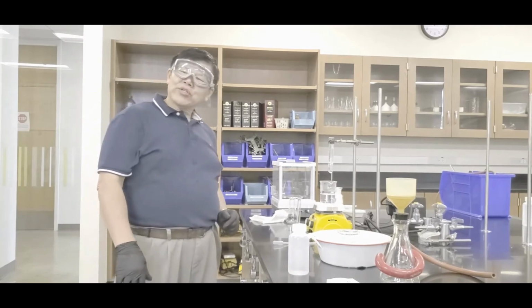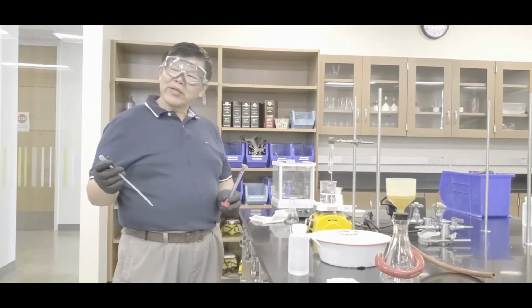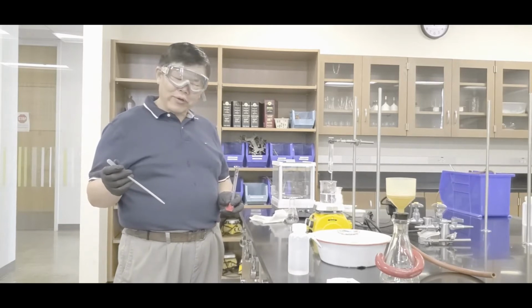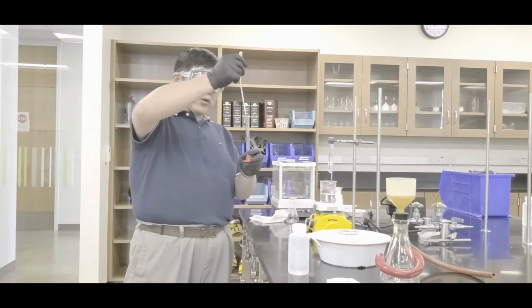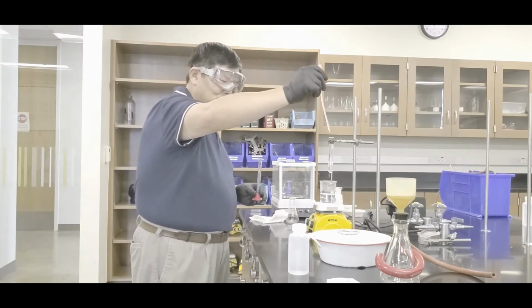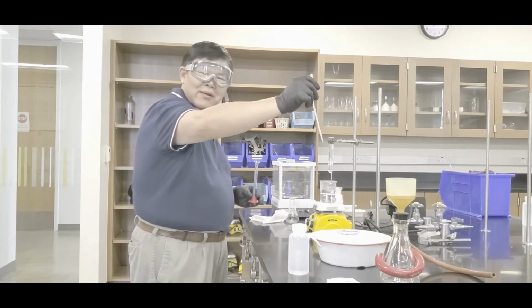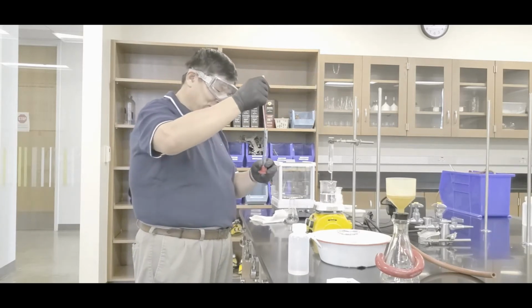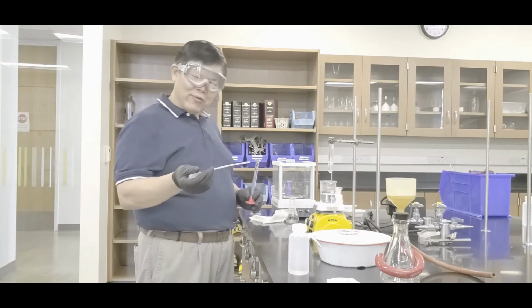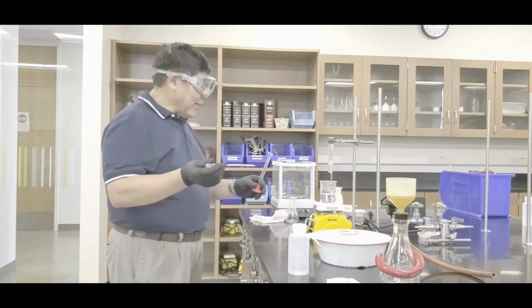All right, we just waited a minute or so. Now what you want to do is this. You're going to add the water in there drop-wise. Do not squirt, okay? I'm going to show you guys. When we mean drop, it means drop, drop, drop, not squirt. Understand? When you squirt like that, the reaction can be fast. All right, so here we go.